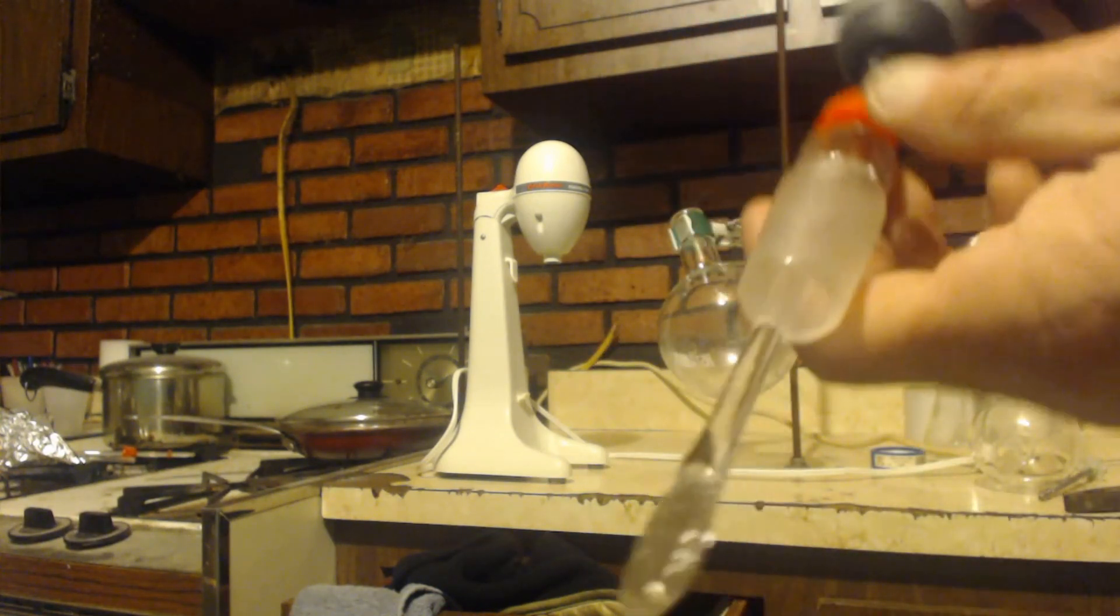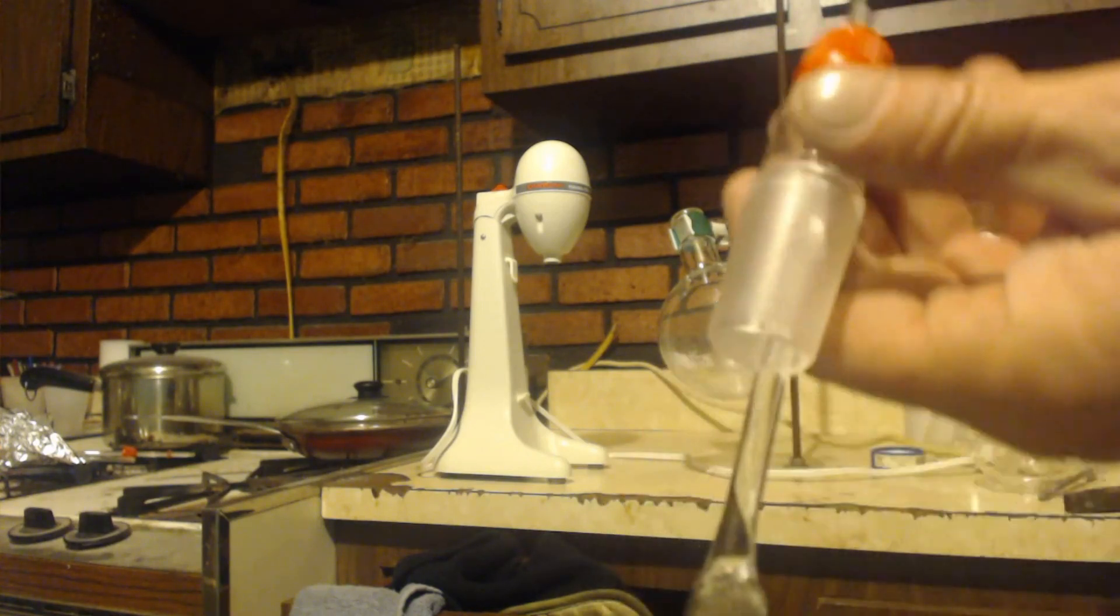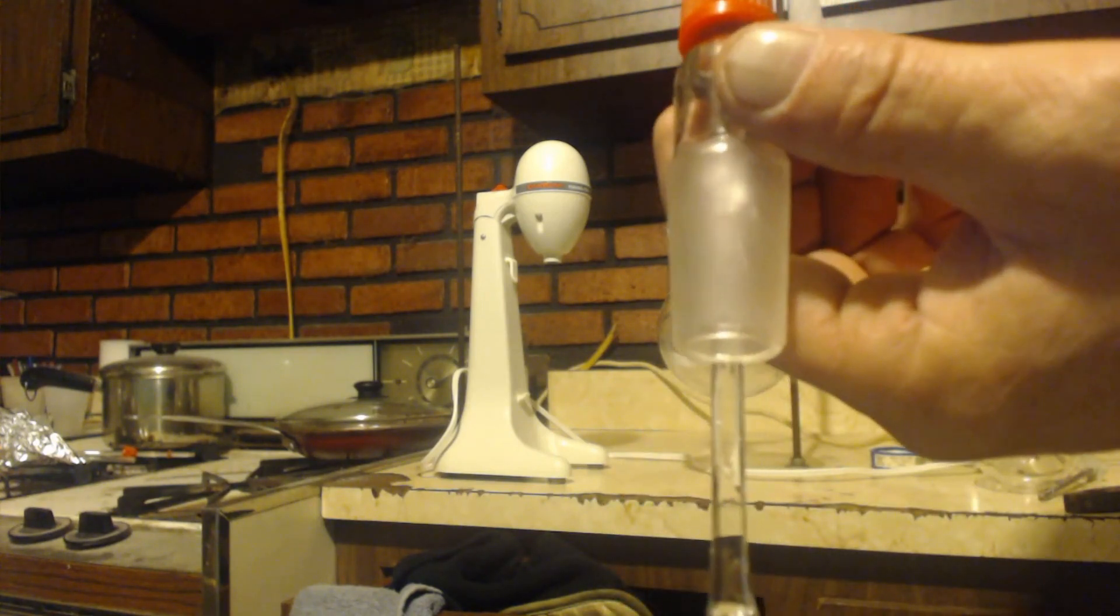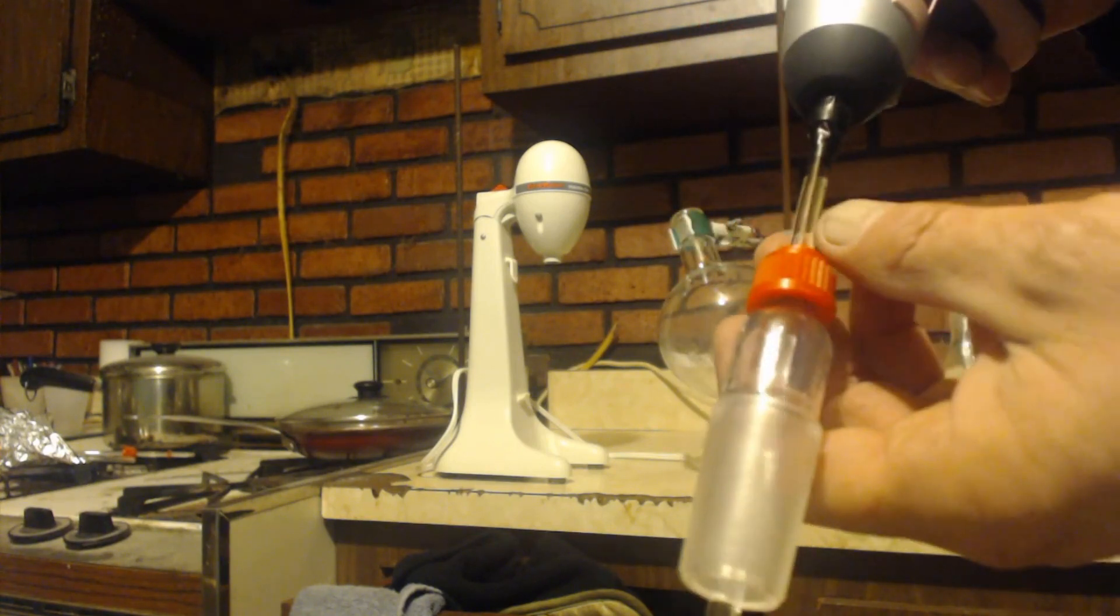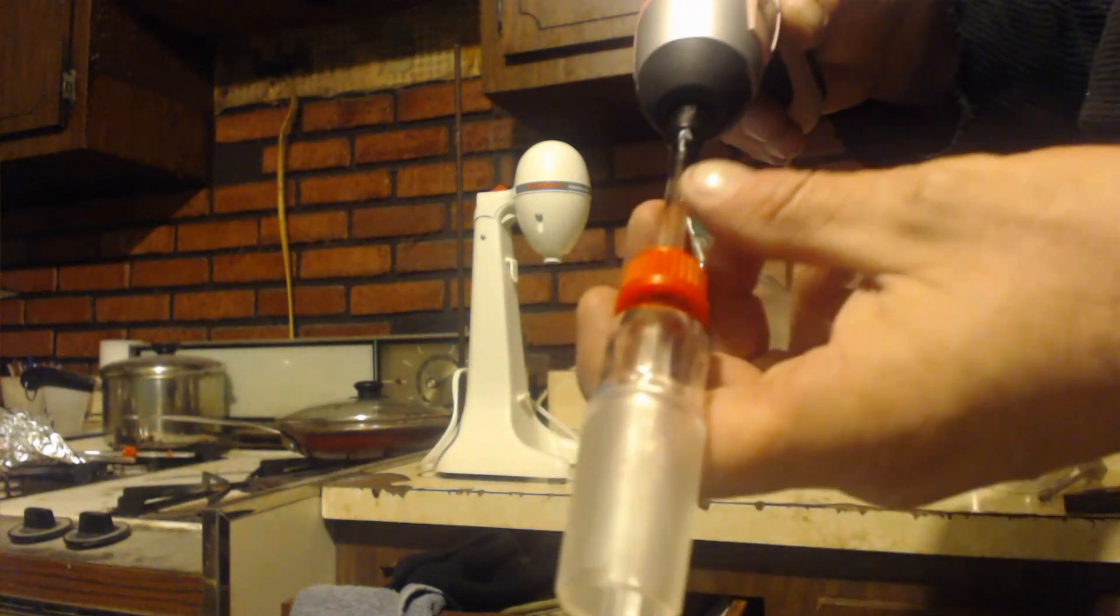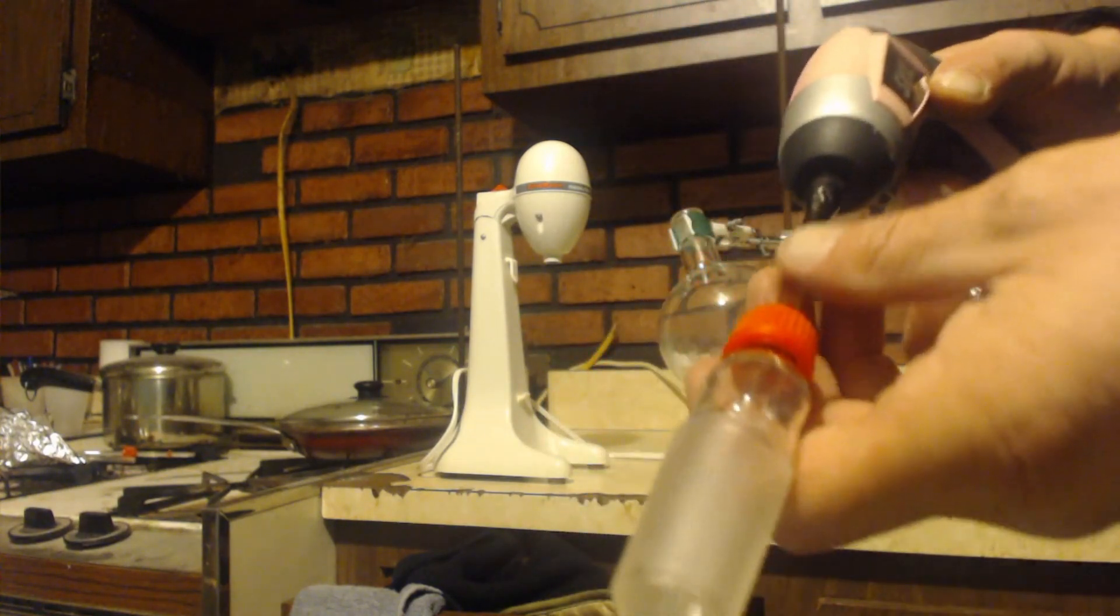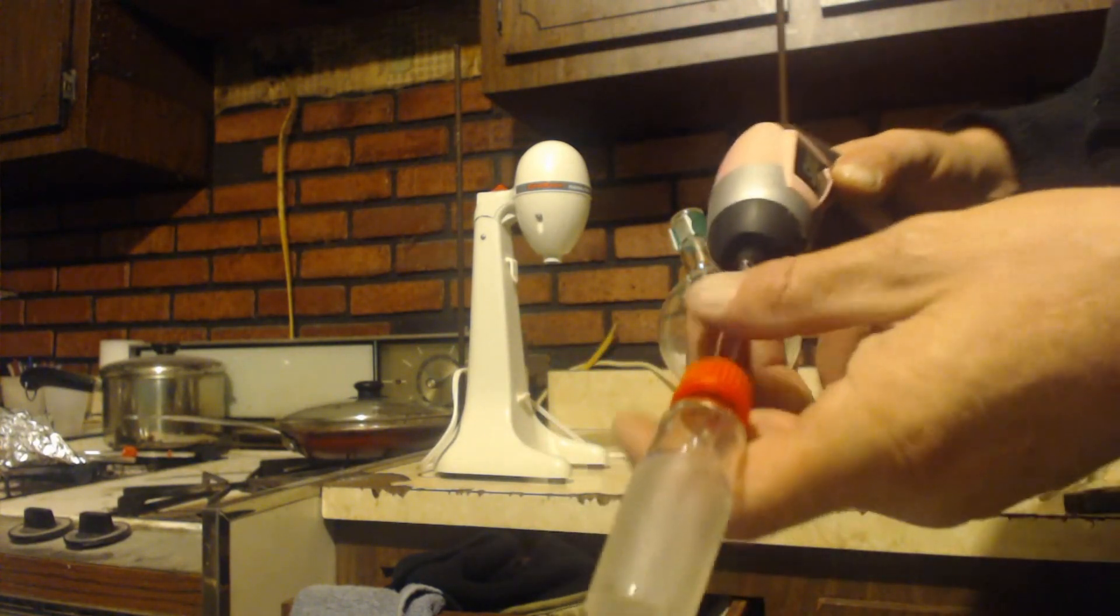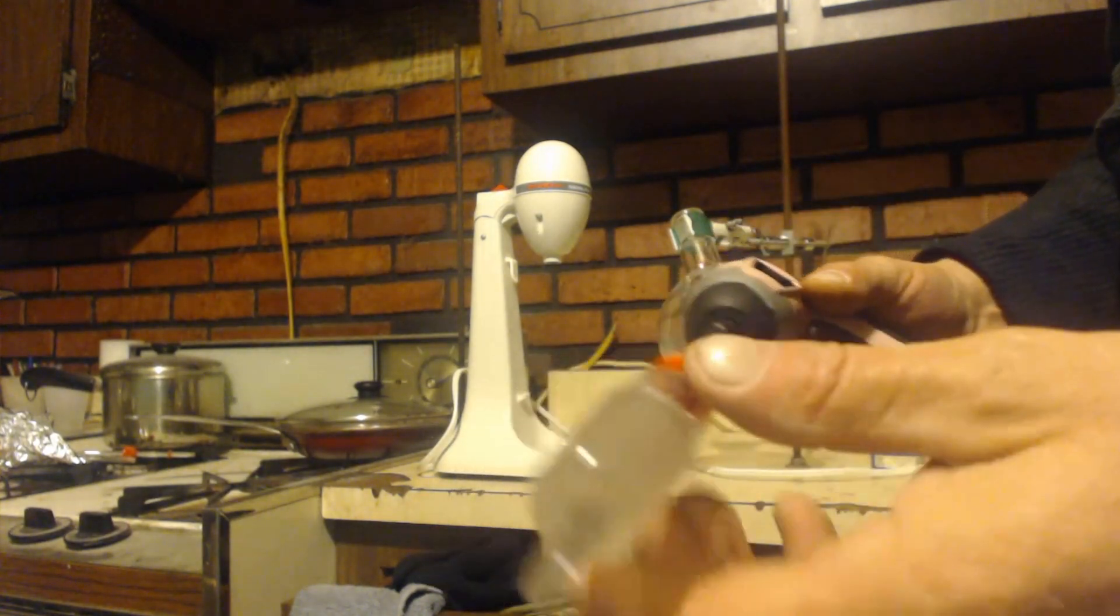Now is this good enough if you're refluxing something, where you have a lot of vapor in the pot? I don't know. You might have to make it longer by either welding them together with heat, a bunch of these stir rods, or just buy one long one, or a tube that can fit, but it has to be the size of your drill bit.